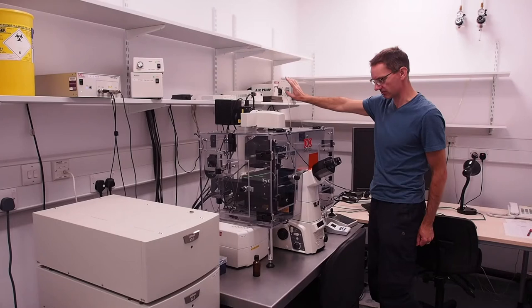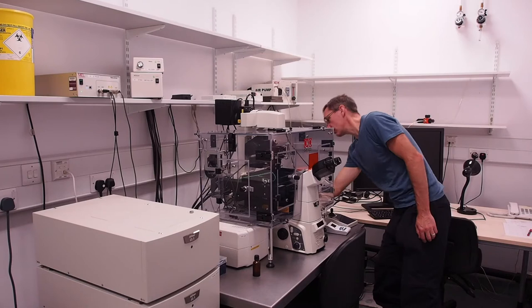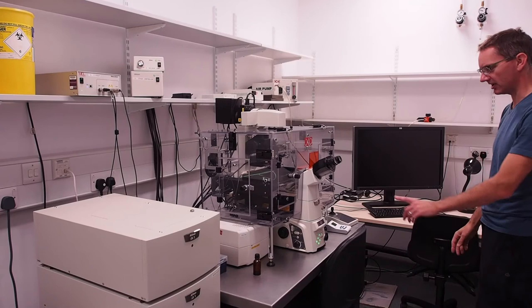Next power on the microscope body which is a switch situated right at the back on the right of the microscope just below the epifluorescence launch tube.